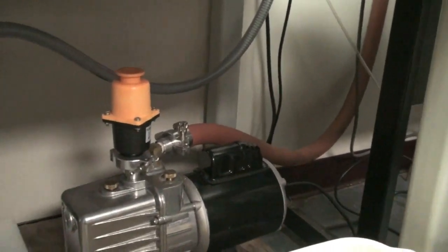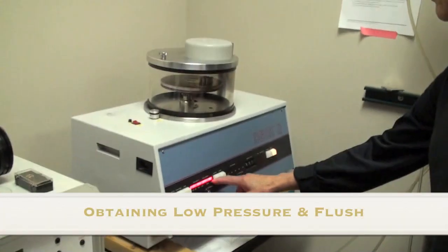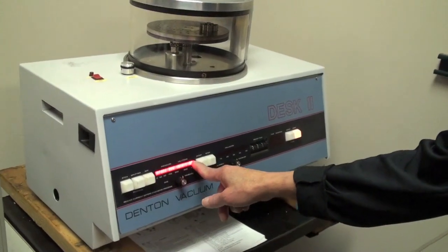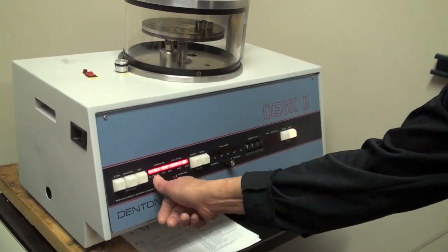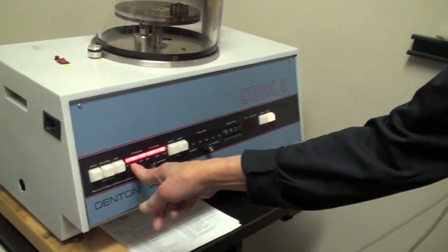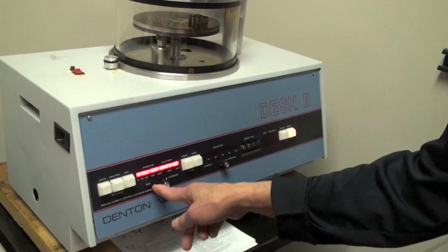Can you hear the pump? This is the pressure reading. We have to pump until the pressure comes down to from the atmospheric pressure to about 50 millitorr.